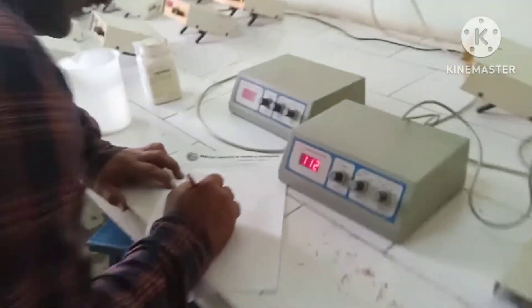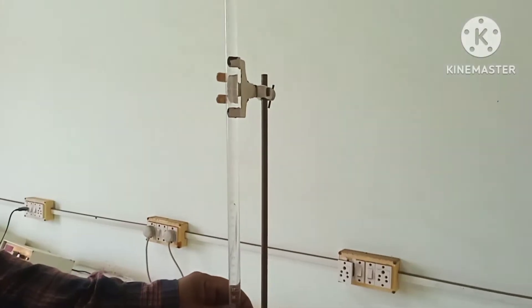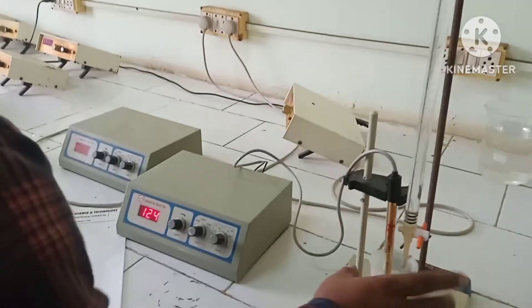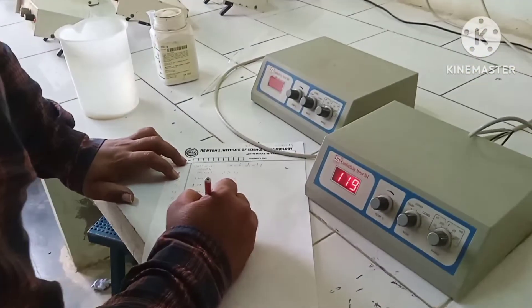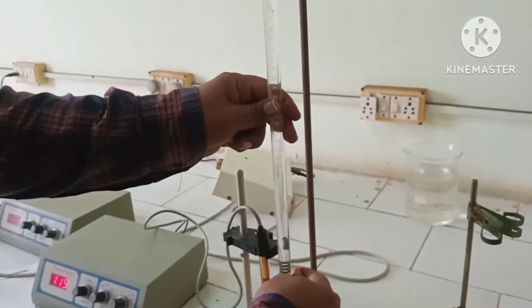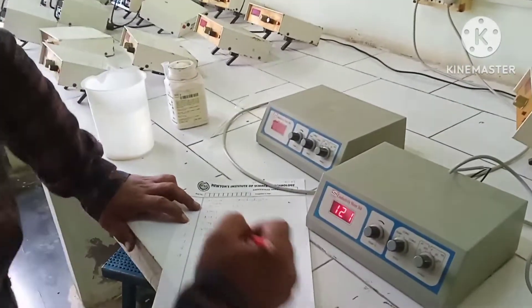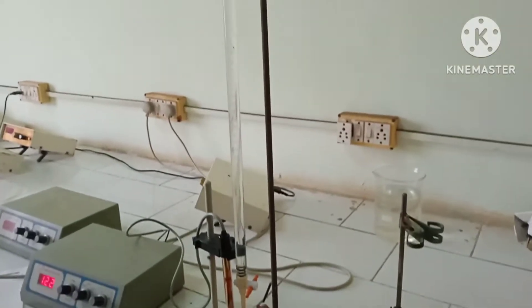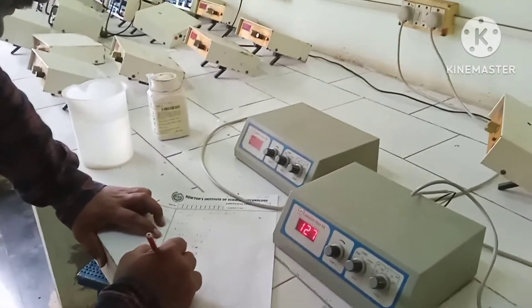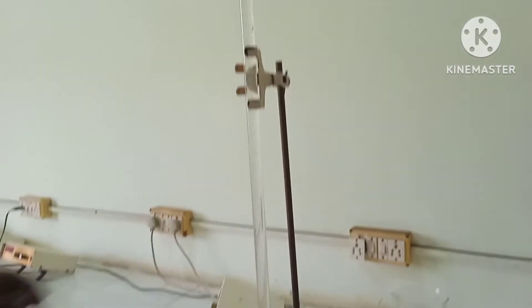I can see the value of 112. The value is 112. Then 119. Then 121. Then 127. Actually, value increases — we don't have to observe it individually, the value increases.